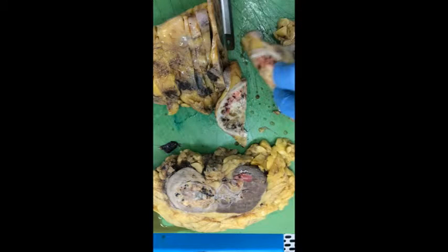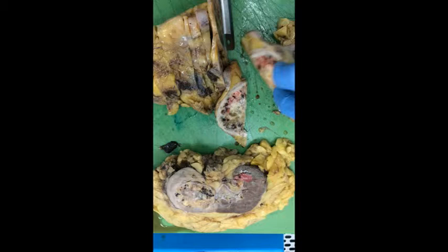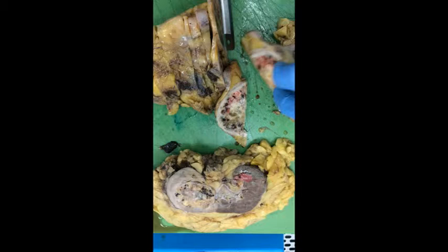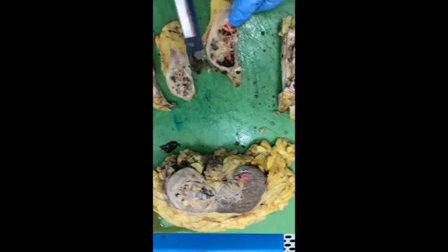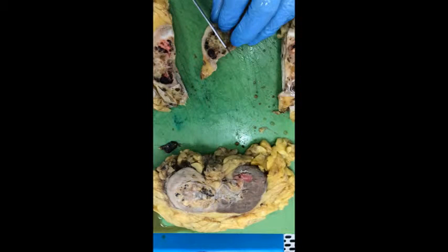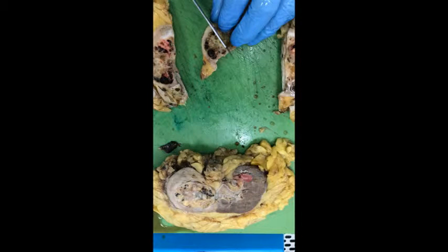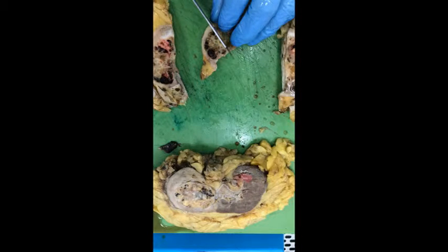Then slice through the kidney, examining the tumour with the perinephric fat. Look for perinephric fat invasion and sample these areas. You can ink this but it's not necessary.